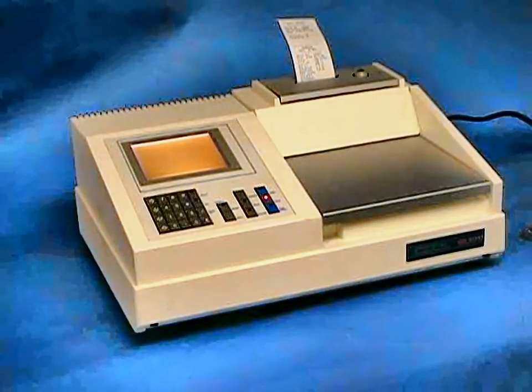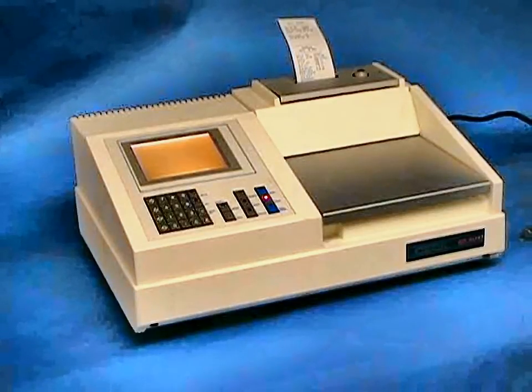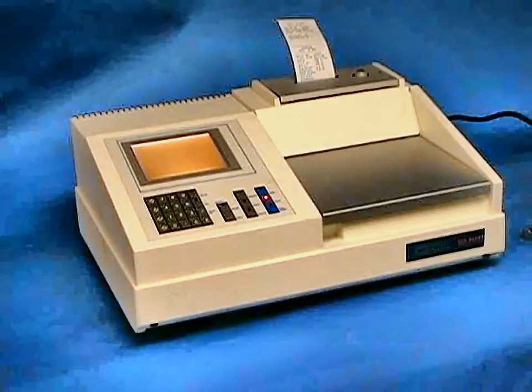This is a CECIL 2000 series spectrometer with a 4 nanometer bandpass suitable for most general analytical purposes. As a single beam spectrometer, you start your day by taking a reference background either on your solvent or just simply air.